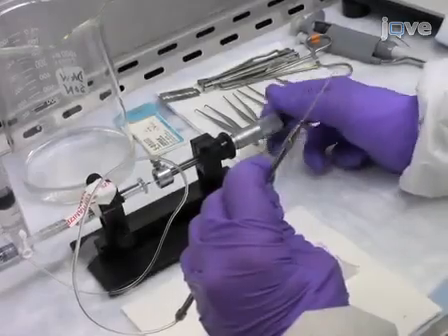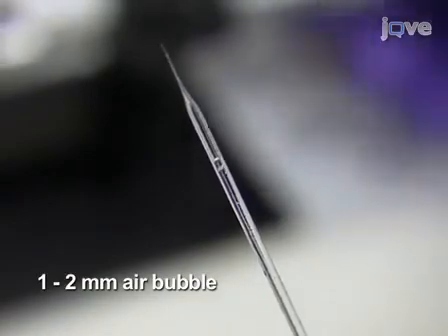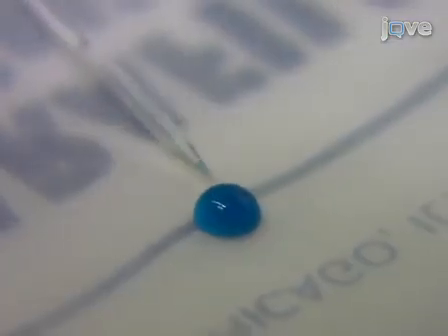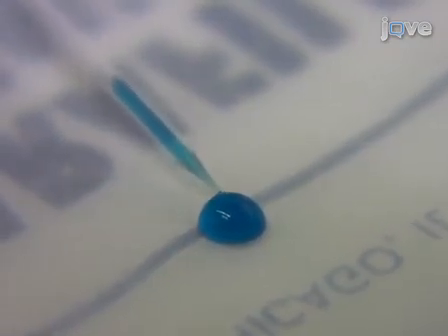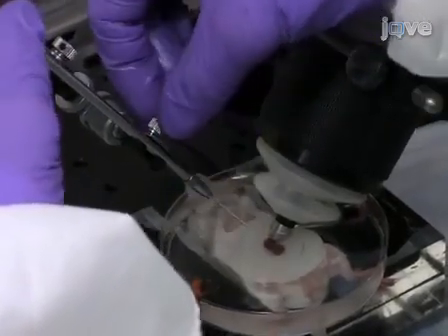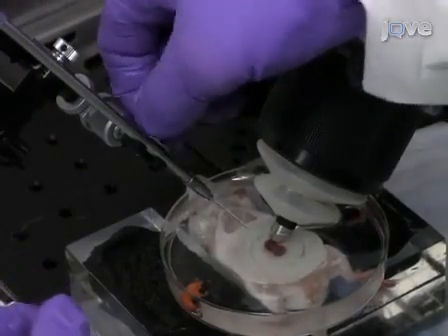Draw back an air bubble from 1 to 2 millimeters long into the needle to maintain separation between the mineral oil and the virus. Use the withdrawal pump to carefully load the needle with virus solution. Draw the solution smoothly and slowly, and pay attention to avoid clogs. Place the loaded needle into the micromanipulator position in the injection area, taking care not to break it on the embryos or the ultrasound probe.